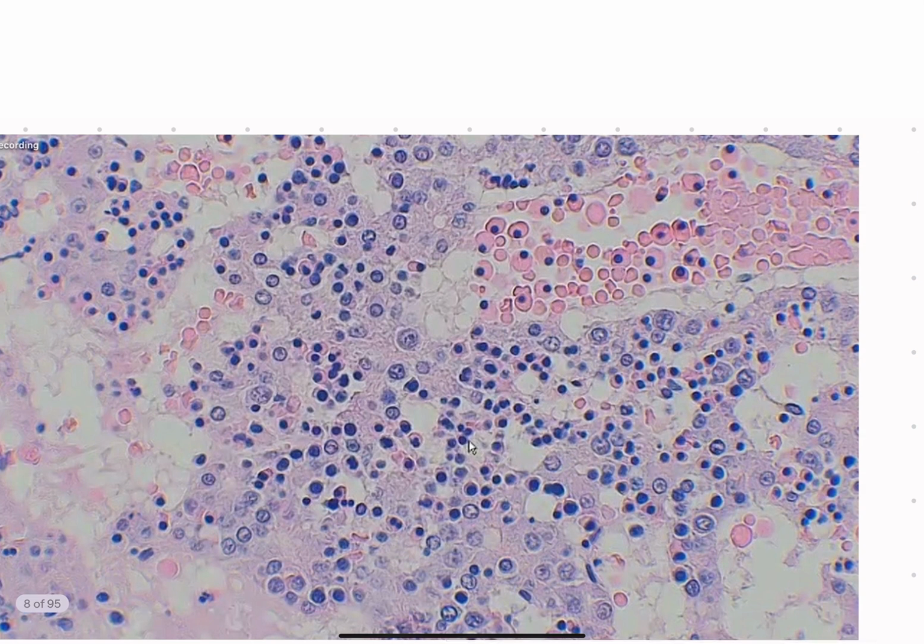And now we see this, again, same structure area where we were before, but now new structure instead. And I'd like you guys to tell me the name of this structure. So slide name the same, just new structure.